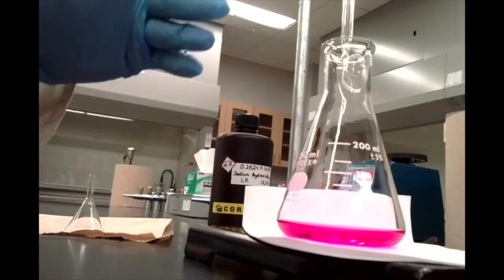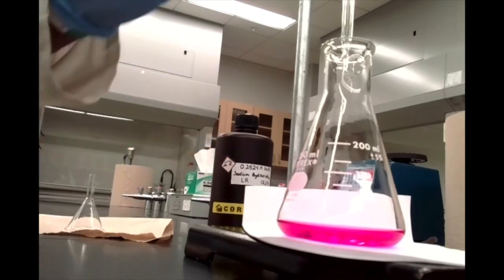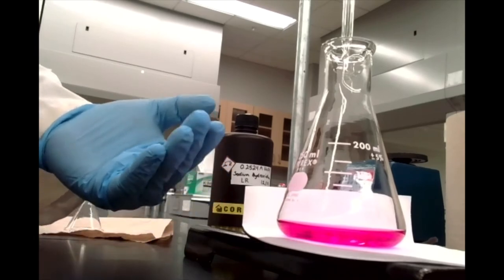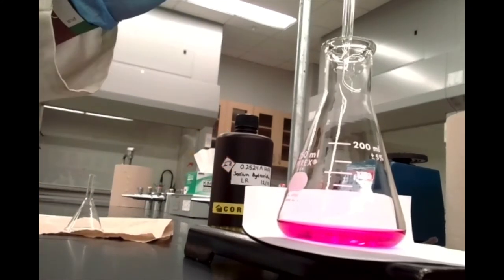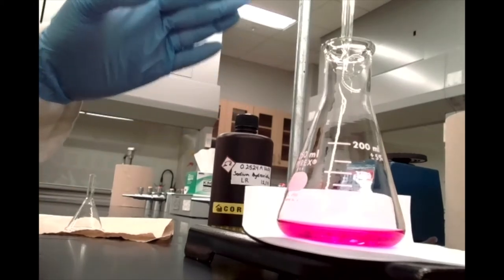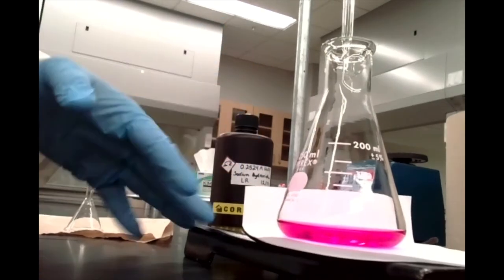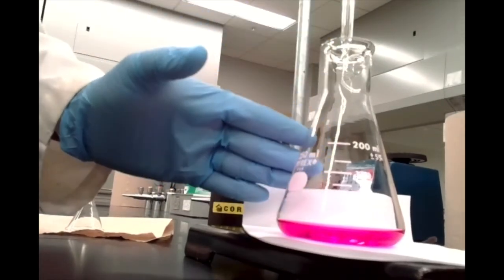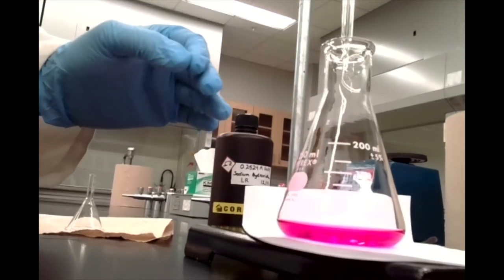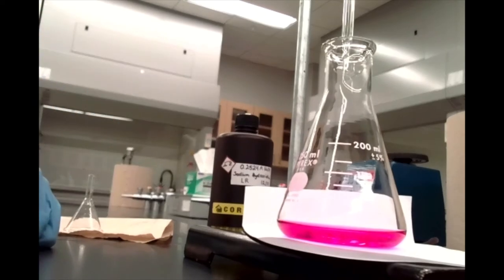The perfect endpoint is where the solution is colorless, you add one more drop, and the pink color stays — that's what we're going to shoot for on our second and third trial.